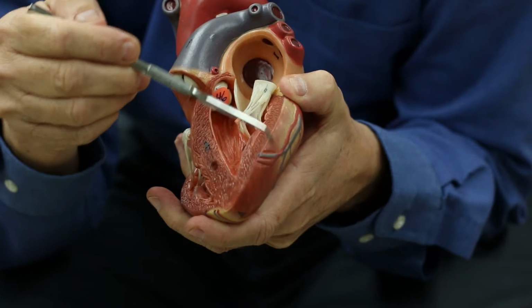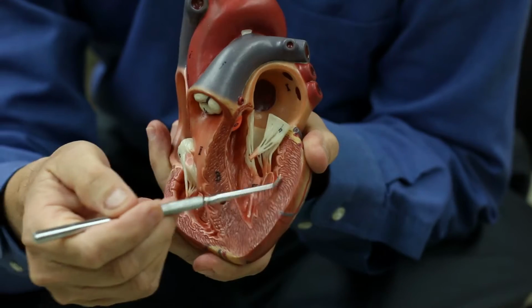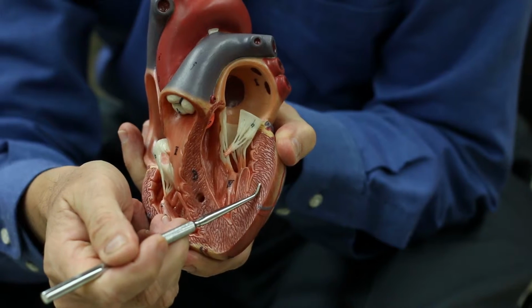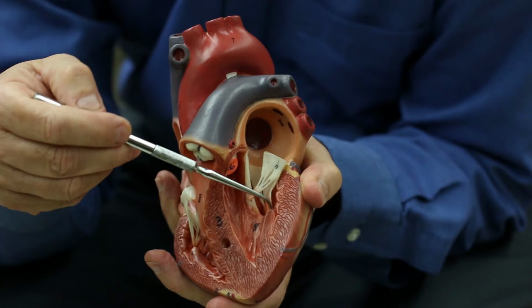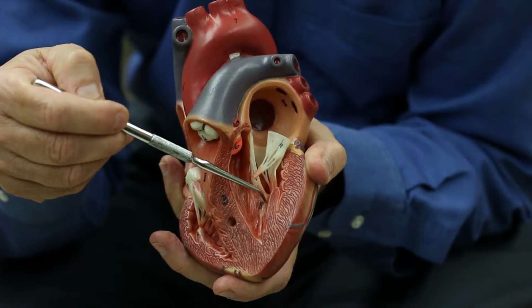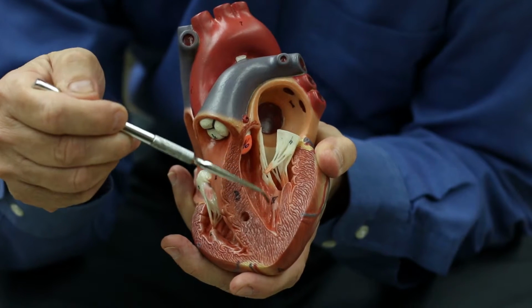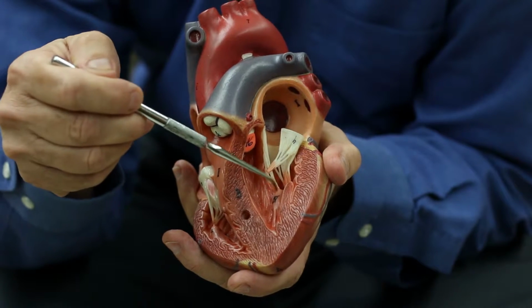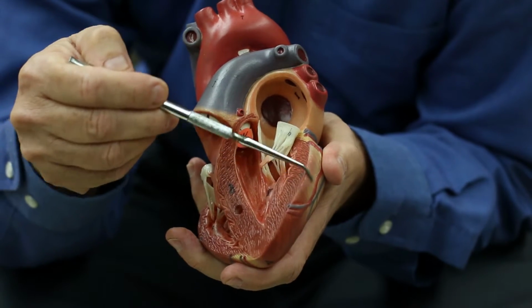All right. Other sections you can see here. On the outside, this is one of the layers of the heart. This is the epicardium. You have the big muscular layer, on the model, the very red layer in here. This is the myocardium, and it is composed of cardiac muscle. It may be hard to see on this model, but you can see there's a slightly different color. This is epithelial tissue that lines the interior of the heart and also the blood vessels coming off. This is the endocardium. So those are the 3 layers. Endocardium lining the inside, the big thick myocardium, and then the outer capsule area is the epicardium.